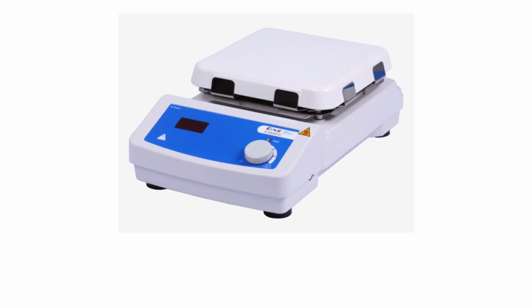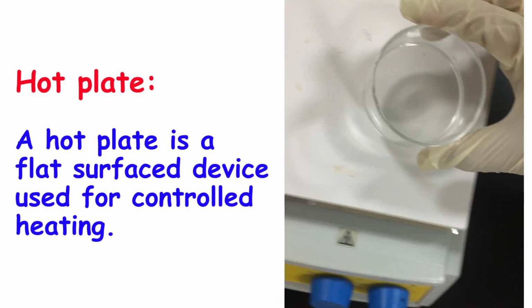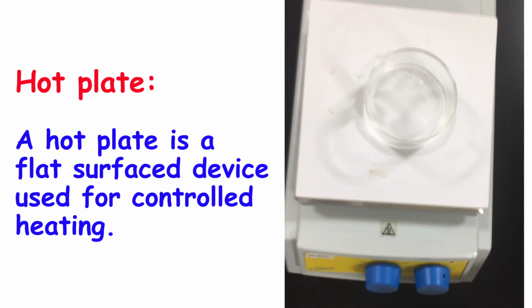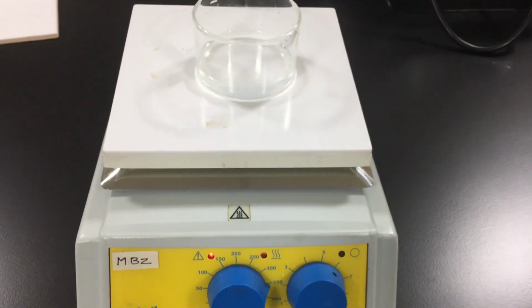A hot plate. A hot plate is a flat surface device used for controlled heating. The hot plate is connected to electricity and is less harmful than the direct flame produced by the Bunsen burner.